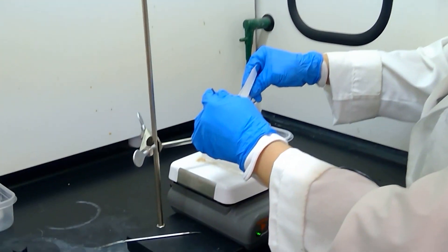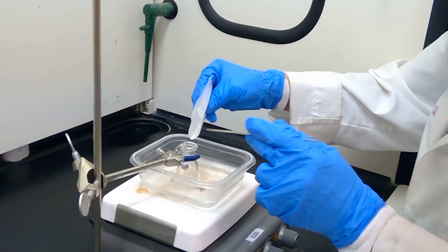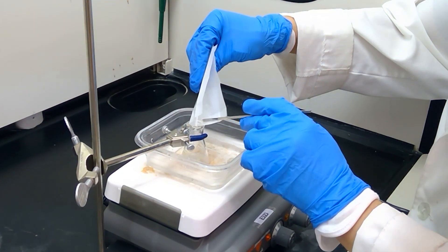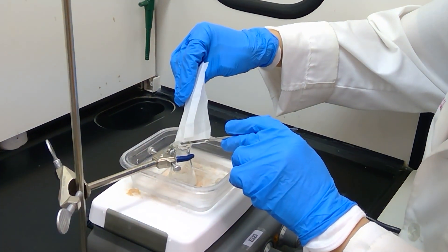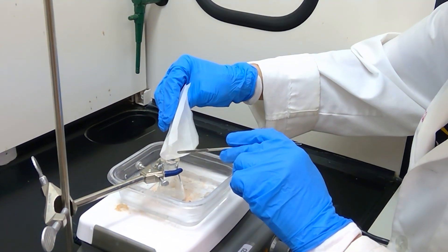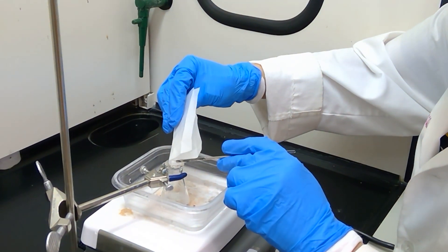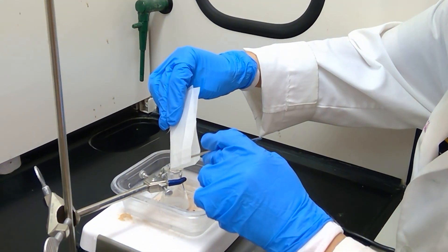The reason for that again is we are generating some hydrogen gas at the bottom which will bubble out. Now that I got the initial reaction to go, I can add my sodium borohydride just a little faster. I'm doing it still slowly just to not overwhelm the system here.